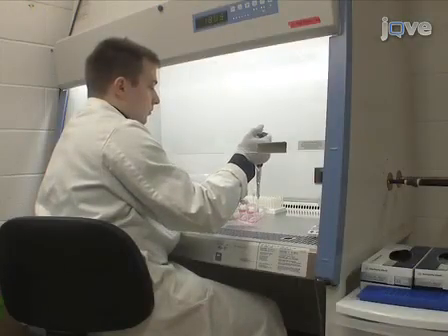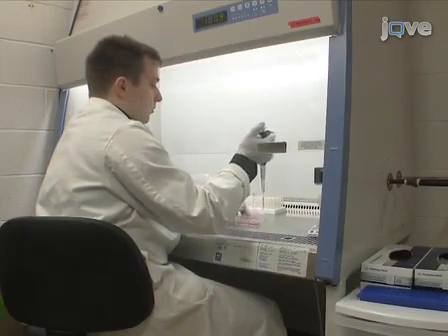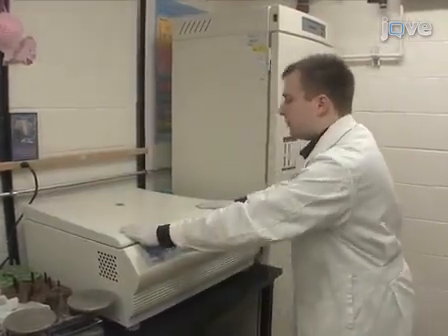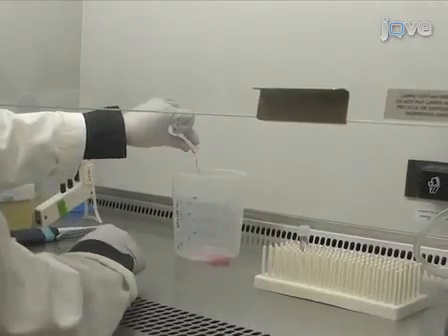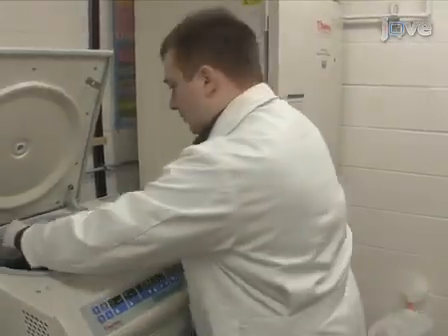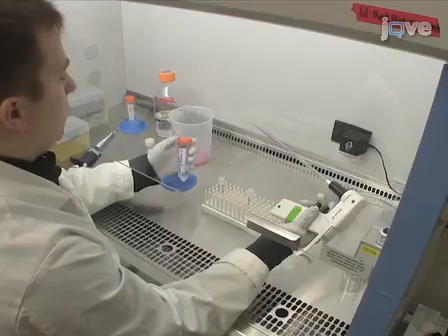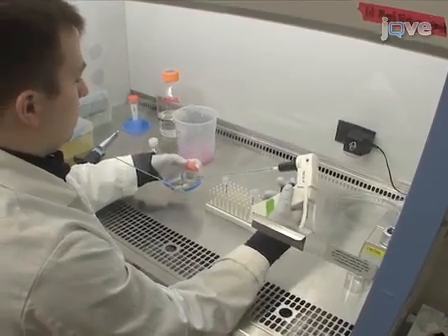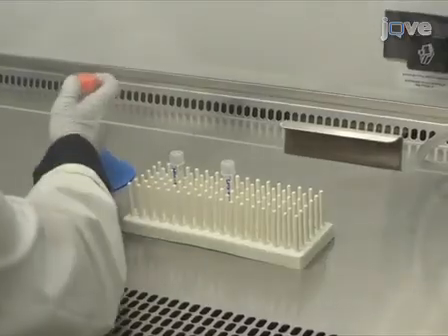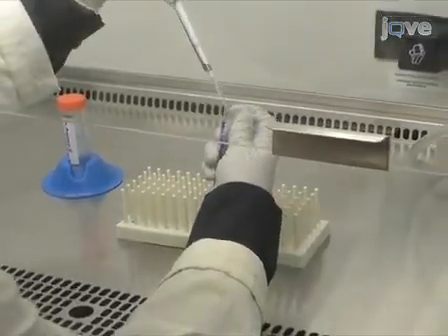Harvest the cells to be analyzed for the experiment. In this video, we use RAW macrophages as an example. Centrifuge the samples at 335 g for 10 minutes at 4 degrees Celsius, decant the supernatant, and resuspend the cells in 2 milliliters of 1x PBS. Then wash the cells again under the same conditions, this time resuspending the cells in 1 milliliter of 1x Annexin V binding buffer. After centrifuging the samples and decanting the supernatant again, resuspend the cells in a final volume of 100 microliters of the 1x Annexin V binding buffer.